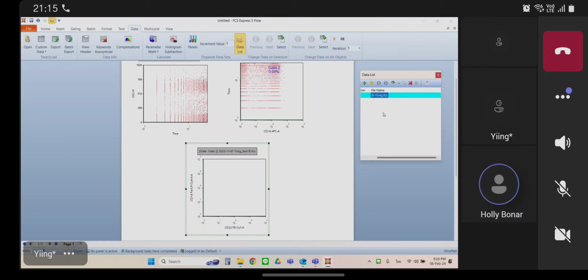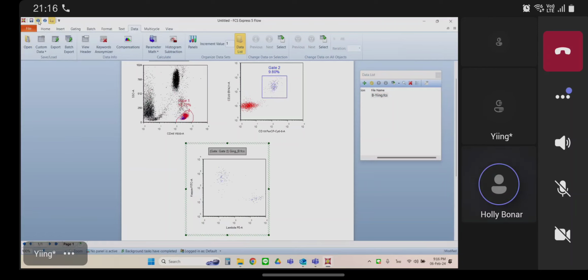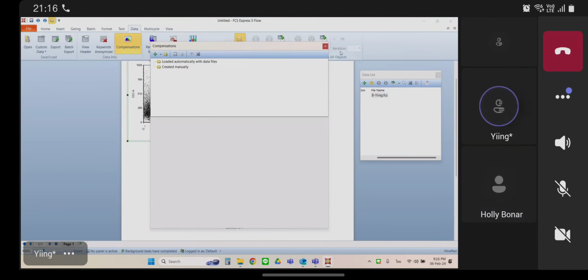Okay, hold on. Let's go back and undo what you just did so we can get back to the other file. Perfect. Okay, so click on one of your plots, and then go up to the data tab and choose view header. The data tab. Yeah, and then kind of over to the left a little bit and down. Yeah, left. Go left.